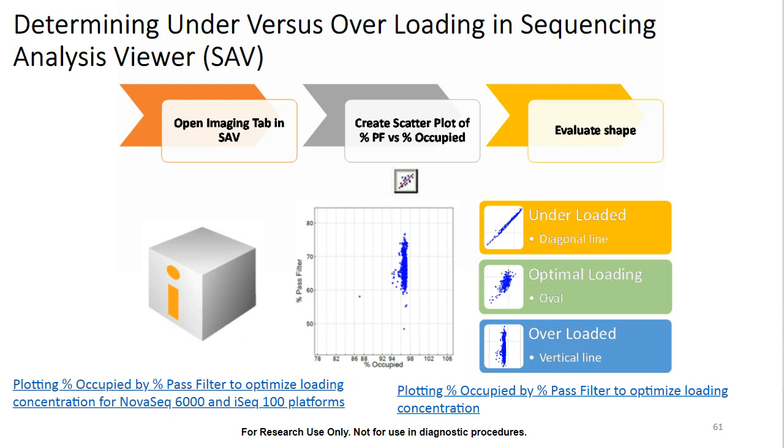So what we're going to do is, in the SAV, click on the Imaging tab, and then there's a Scatter Plot button that you'll see, and then click on that. It'll open up another dialog window. We can then select percent passing filter and percent occupied as our two things that we want to graph, and then evaluate the shape. So underloading is going to show a very strong linear response between percent passing filter and percent occupied. So it'll show as a diagonal line at about a 45-degree angle.